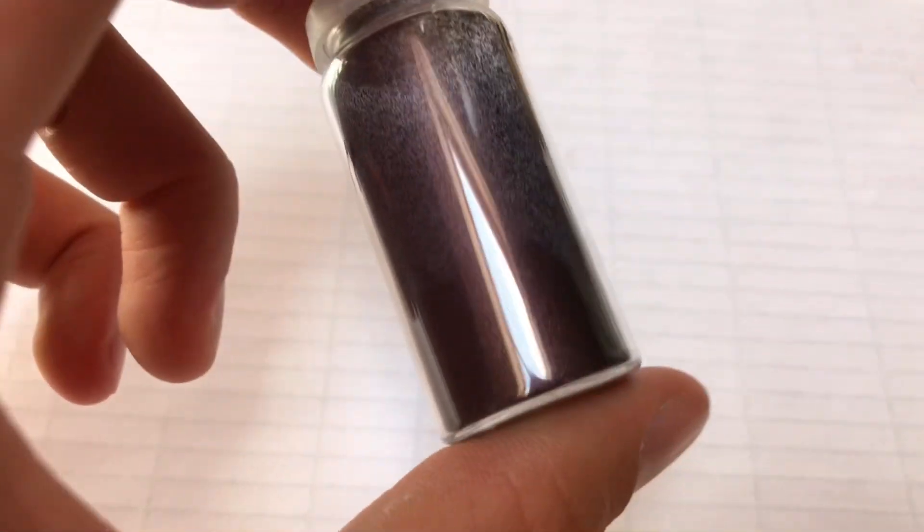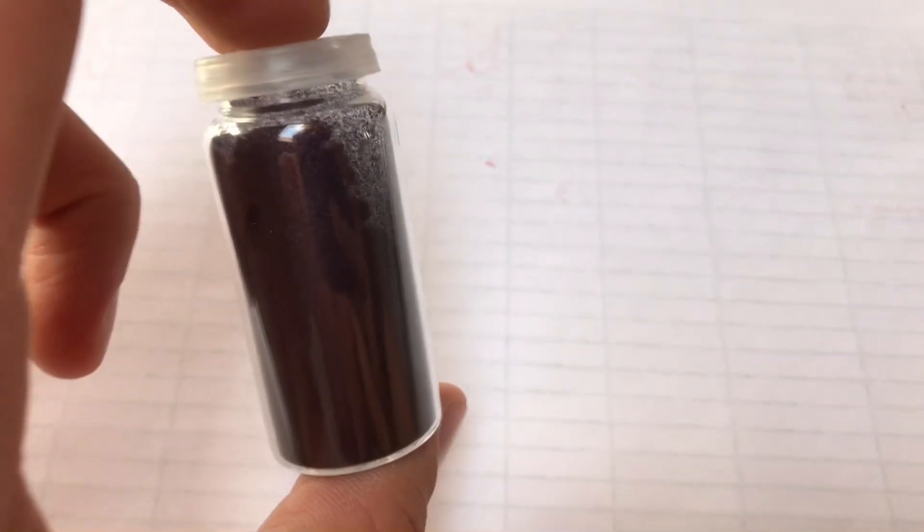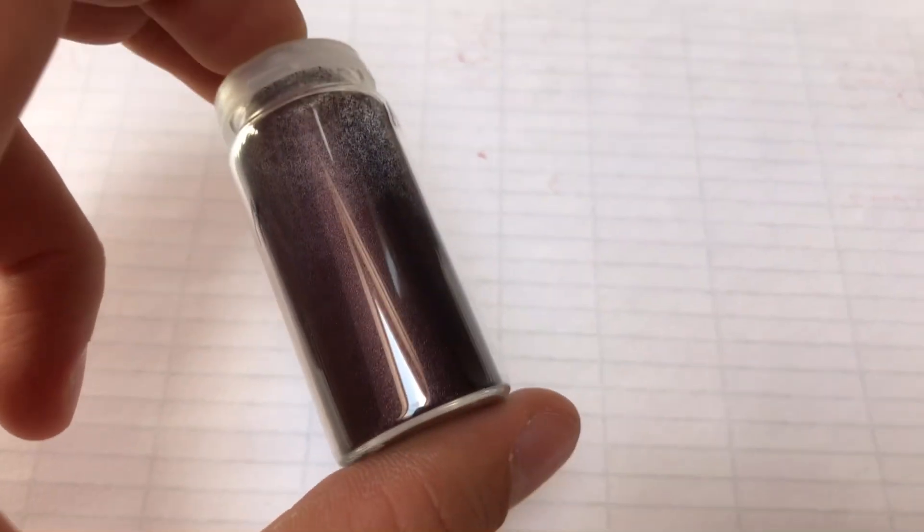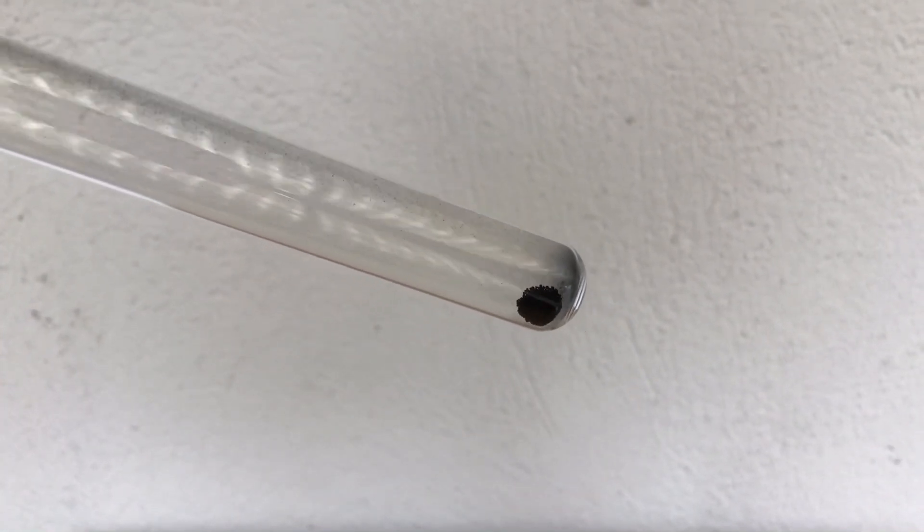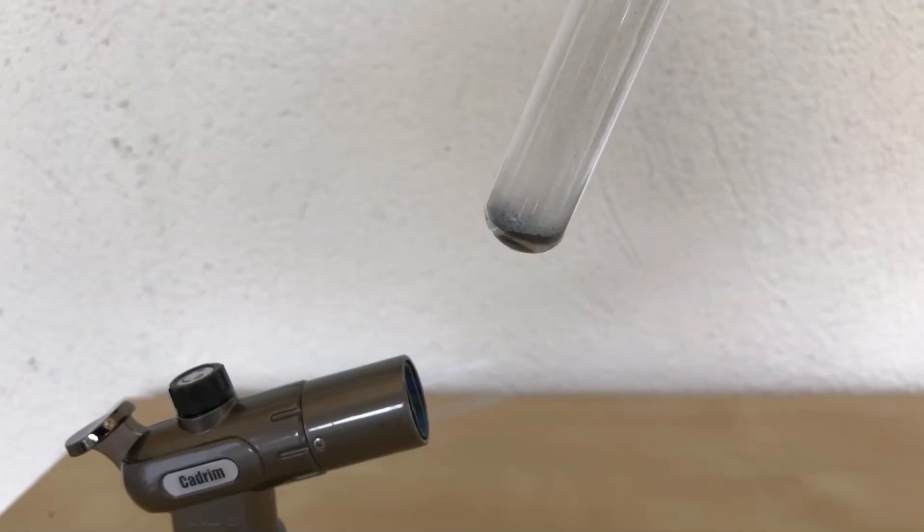We ended up with 1.5 grams of product, which is a poor yield. But this was only a proof of concept anyways. The most interesting part about this pigment is not that it is blue, it is that it can sublimate.